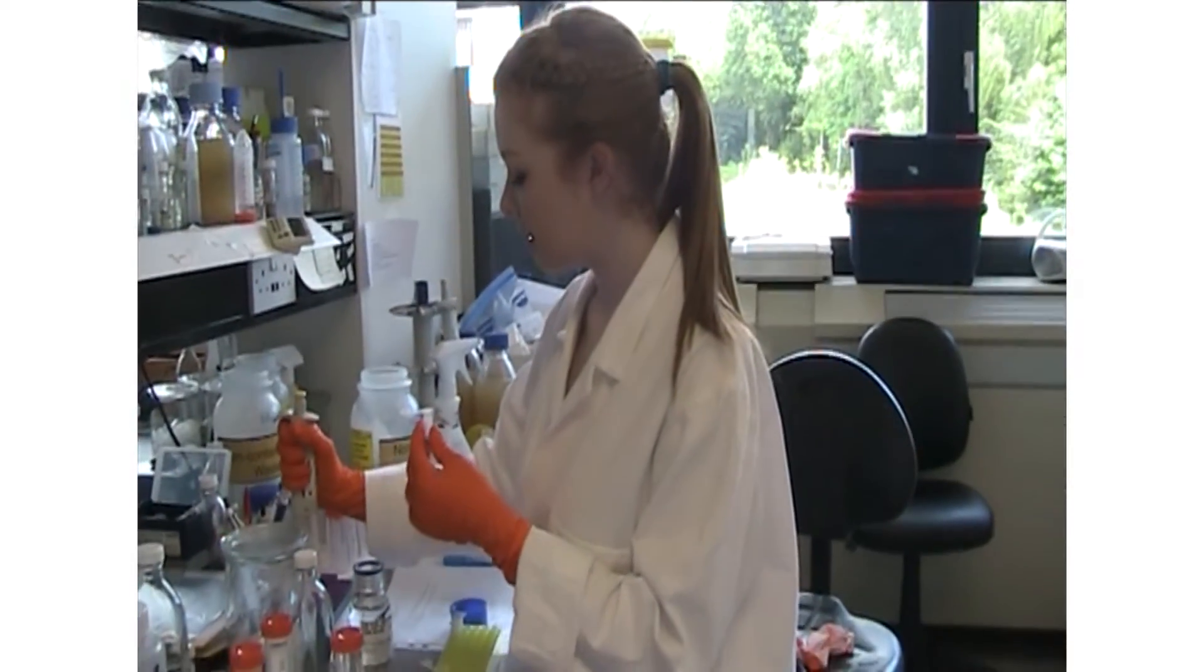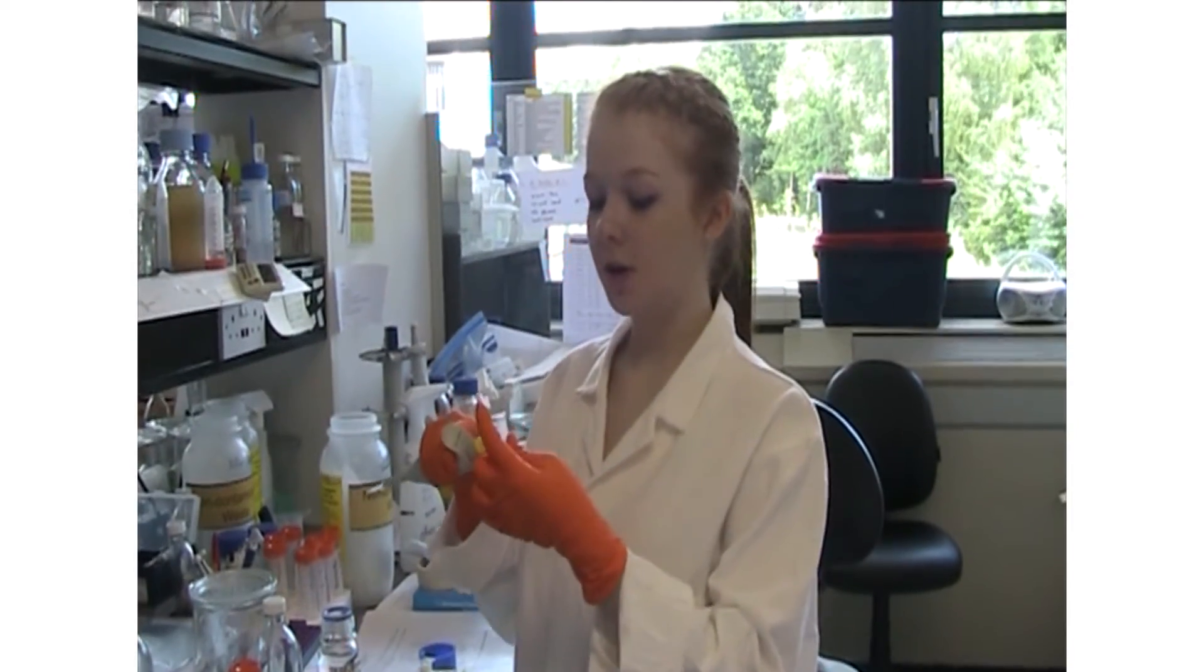We are now using an extraction solution to extract DNA.